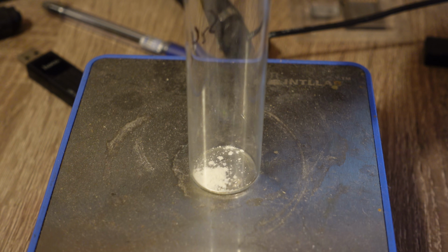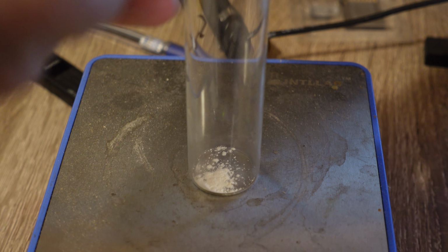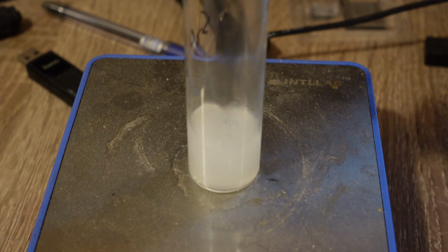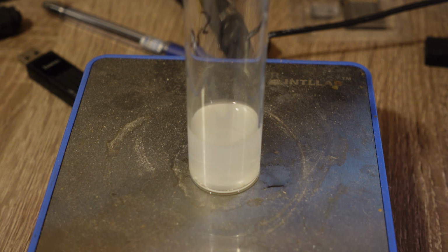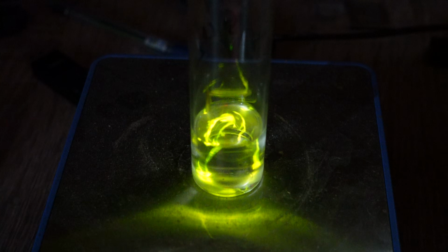For some time I was bothered by the question, what happens if you don't add the fluorescent dye to the reaction? Will we see white light or will the light be released as ultraviolet? The answer is no, we won't see any light, not even ultraviolet in that case. I even conducted an experiment. I took dinitrophenyl oxalate in ethyl acetate and added hydrogen peroxide. Absolutely nothing happens, but you only need to add a little bit of fluorescent dye to the solution and the mixture starts to glow.